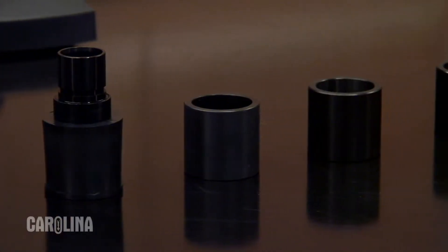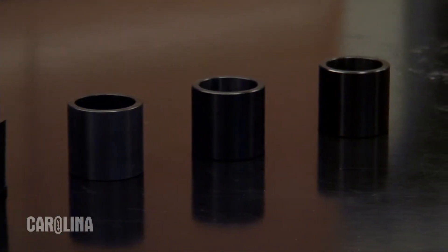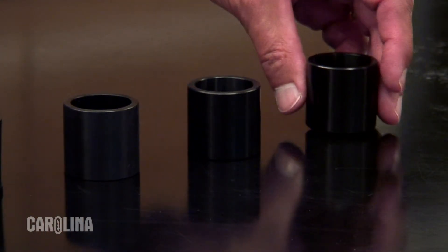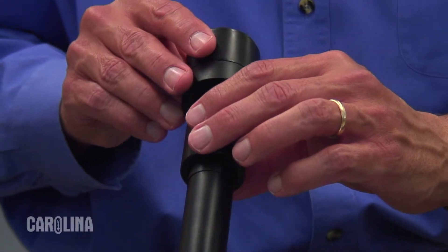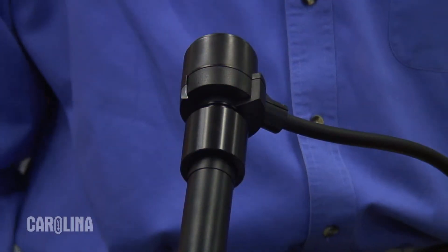The StudentCam can also display large images from both compound and dissecting microscopes. The camera comes with four microscope adapters so it can easily fit on any full-size microscope. Simply choose the adapter to fit your microscope, place it over the eyepiece, and connect the camera to the adapter.